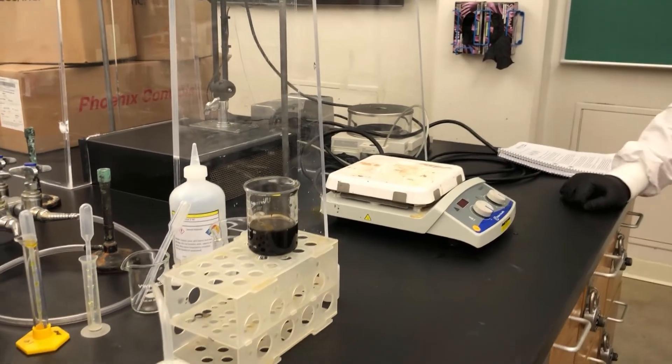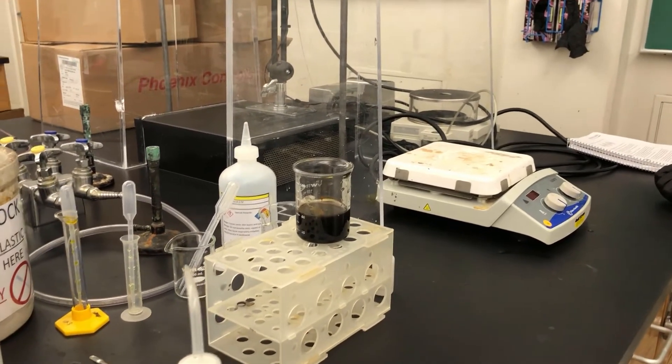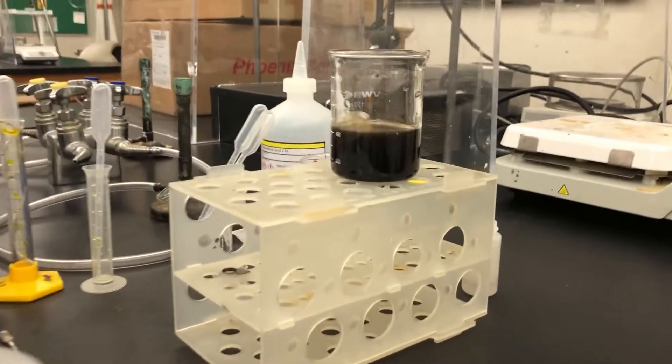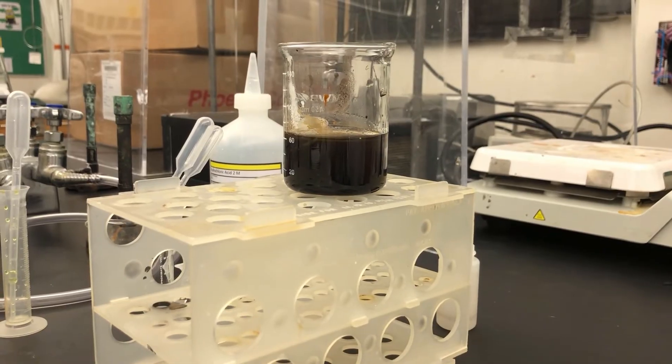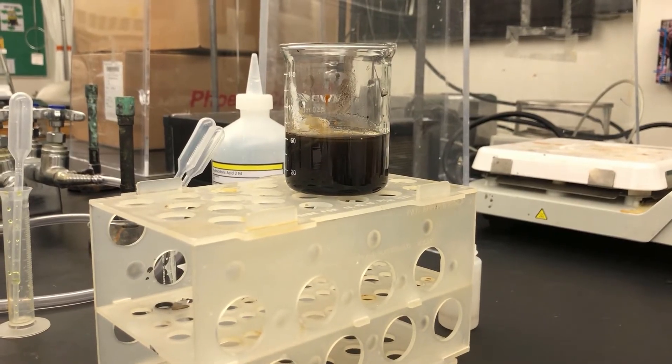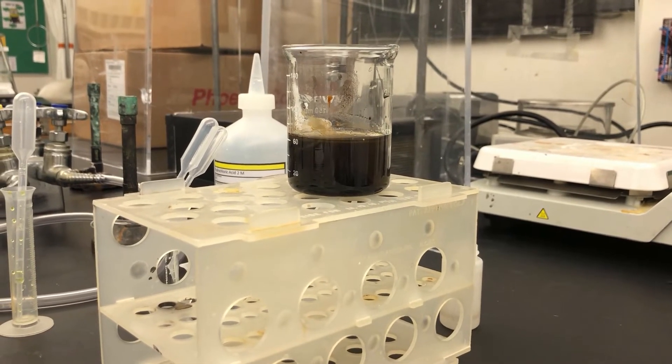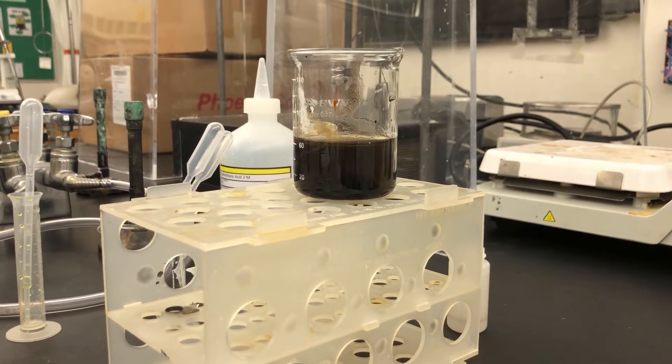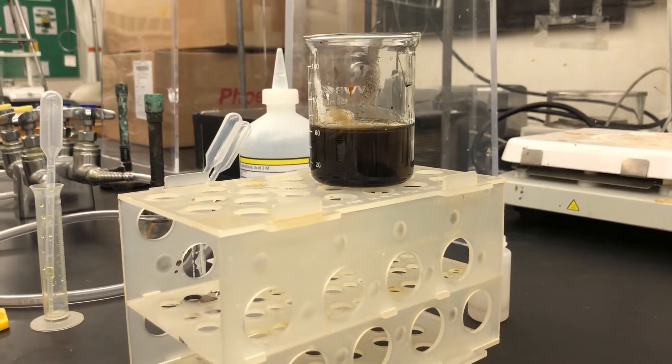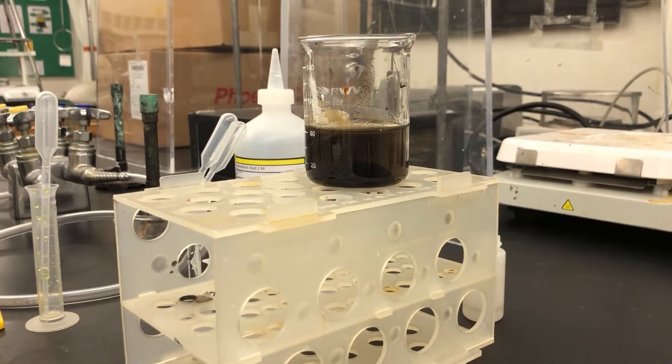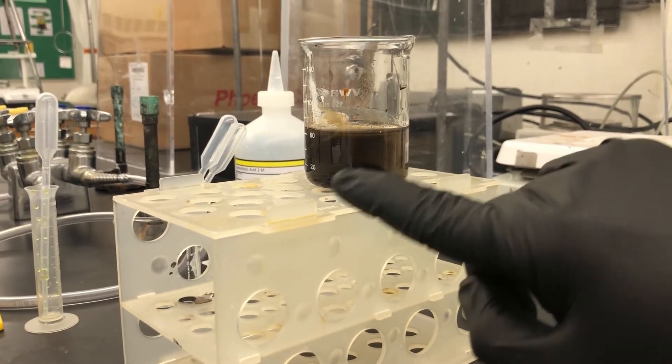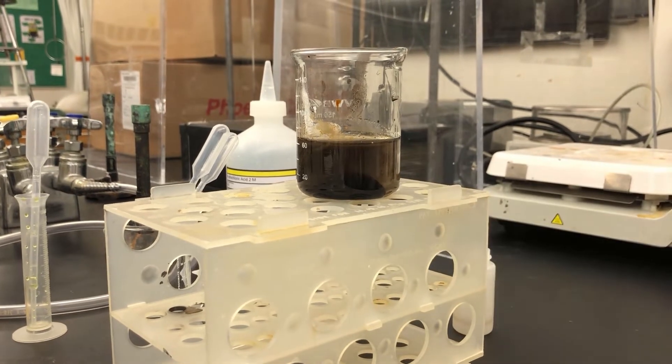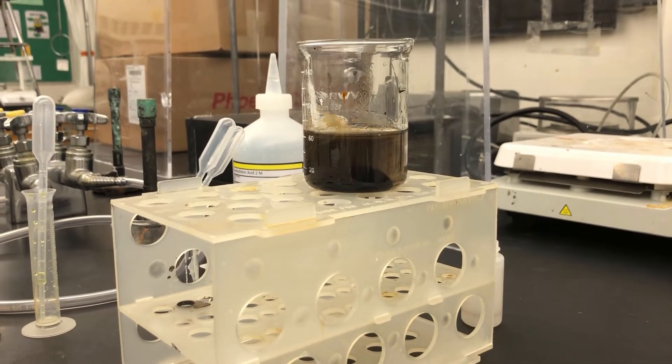And we're going to let that sit until all the particles come to the bottom and gather at the bottom of the beaker. As you can see, you can see the little gathering mound of our nanoparticles. So we know that the magnet is working.